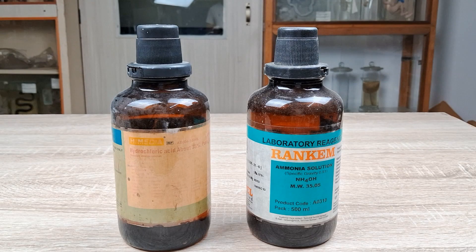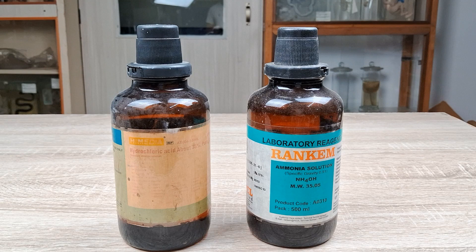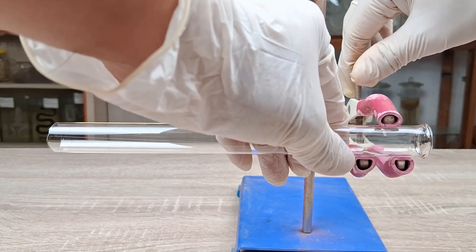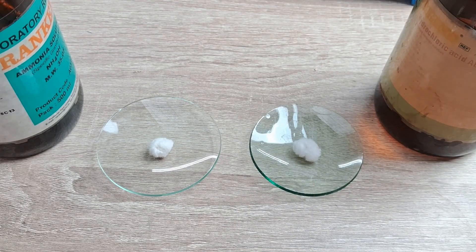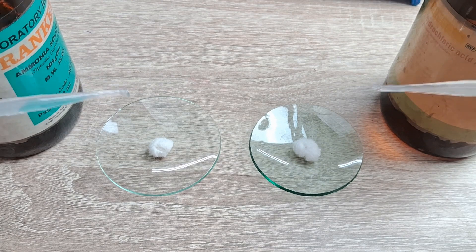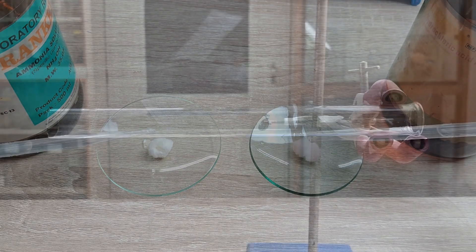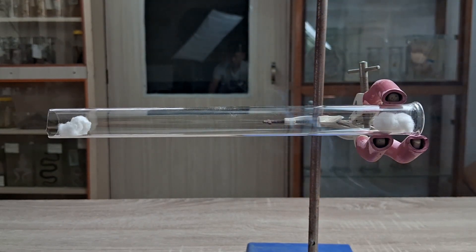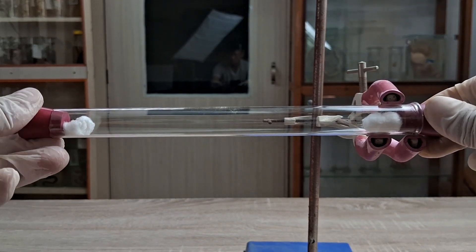To perform this experiment, first bring the two chemicals ammonia and hydrochloric acid to the experiment table, preferably inside a fume cupboard or in a well-ventilated area. Take the cylindrical tube and fasten it on a retort stand using a finger clamp. Take two cotton balls in two watch glasses or petri dishes and add several drops of ammonia and hydrochloric acid to each cotton ball using the droppers. Introduce the two cotton balls, one on each end of the glass tube, at the same time. Stopper the open ends of the tube with the rubber corks, also at the same time. Allow the setup to remain undisturbed and observe closely.